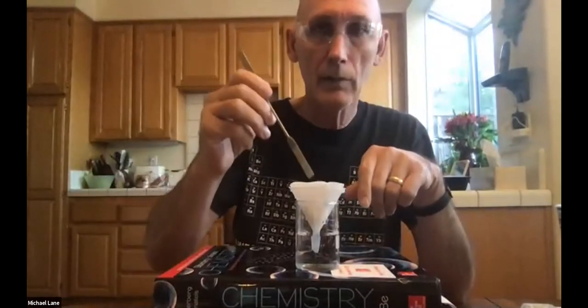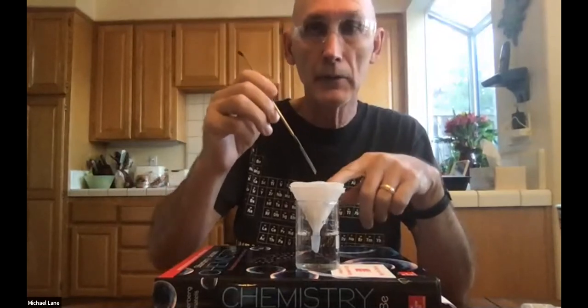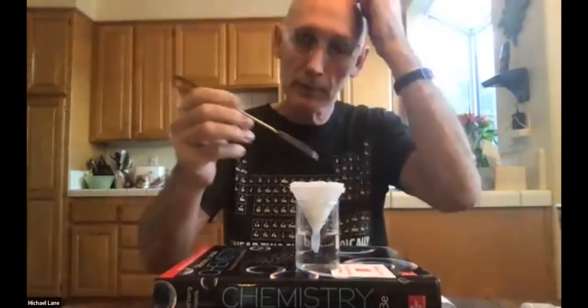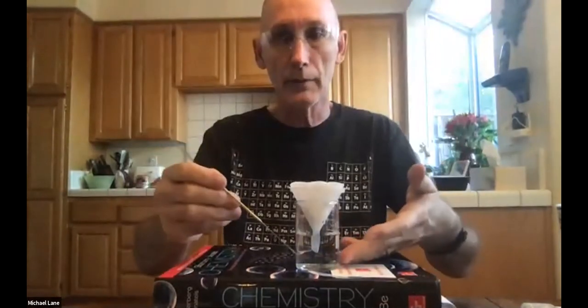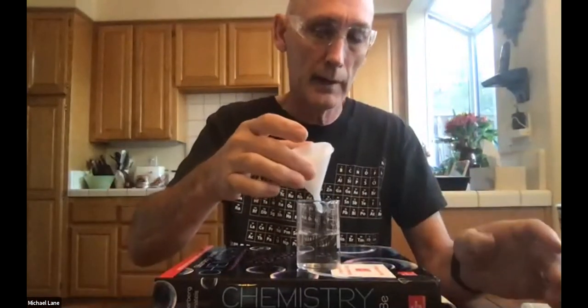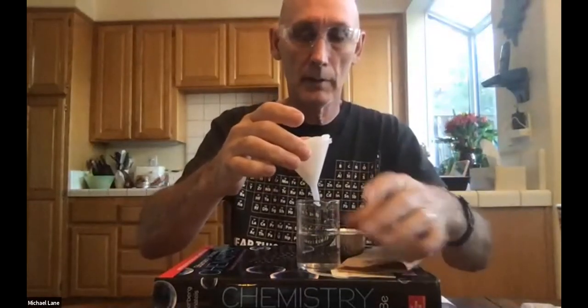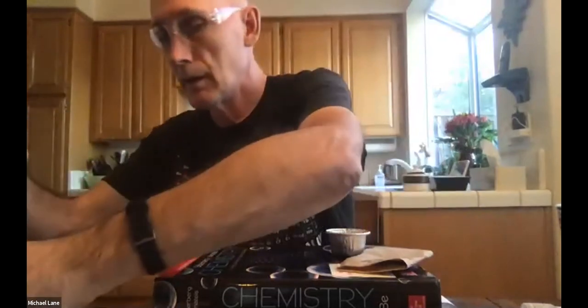Okay. So again, one of the things I want to warn against is do not try to move anything around in here. If you do so, you will almost certainly tear the filter paper. If you tear the filter paper, of course, the calcium carbonate will go right through down into here, which is where we don't want it. So again, I've been very careful not to do that. So we're going to get any of the last little bits out. And now I'm going to get this up here. Let me set this aside.